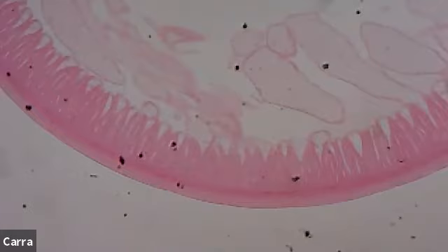Okay, so roundworms are pseudocoelomates. They have less complexity than a coelomate would, or an earthworm. And so they only have one type of muscle. So instead of having longitudinal and circular, they only have longitudinal. And so their movements are going to be a lot more spastic, is the best way to put that, because they have less options on how they move. Whereas an earthworm with two different kinds of muscle groups can have really complex control over its muscles. It can do a lot more stuff, right? But we're looking at the roundworm. It's a little bit more simplistic.